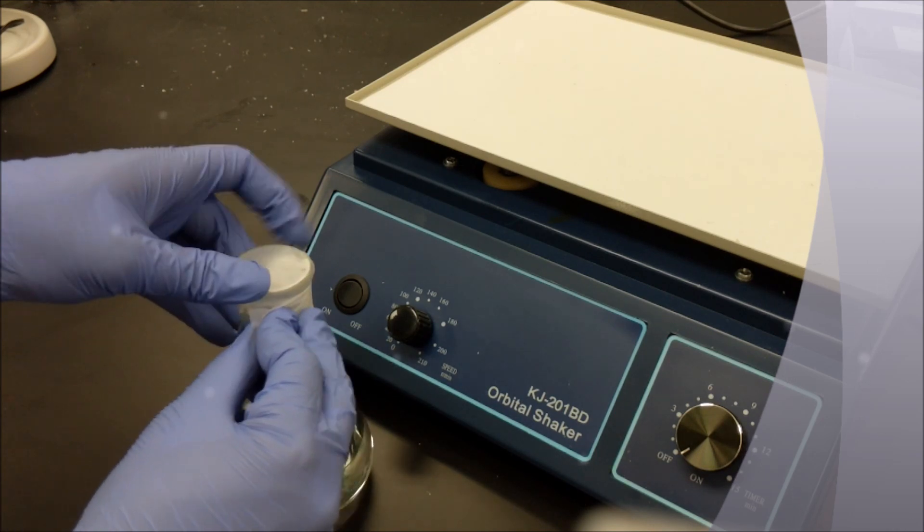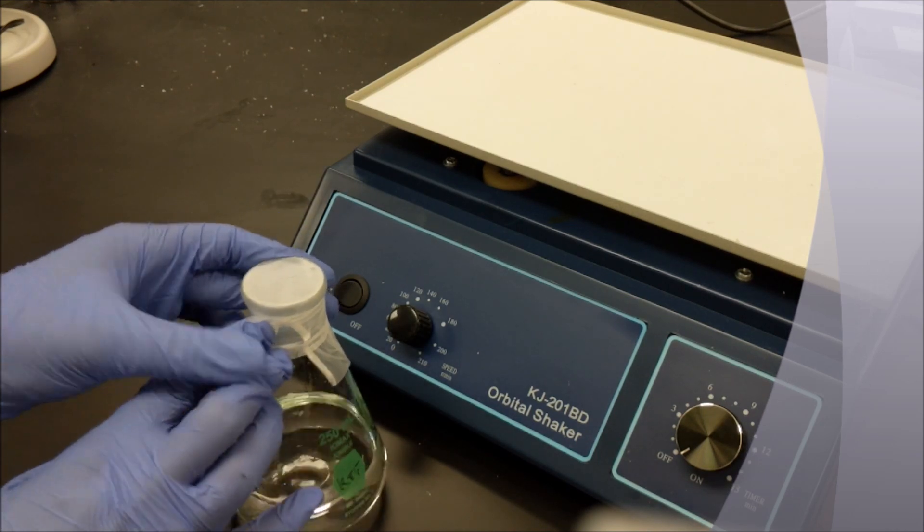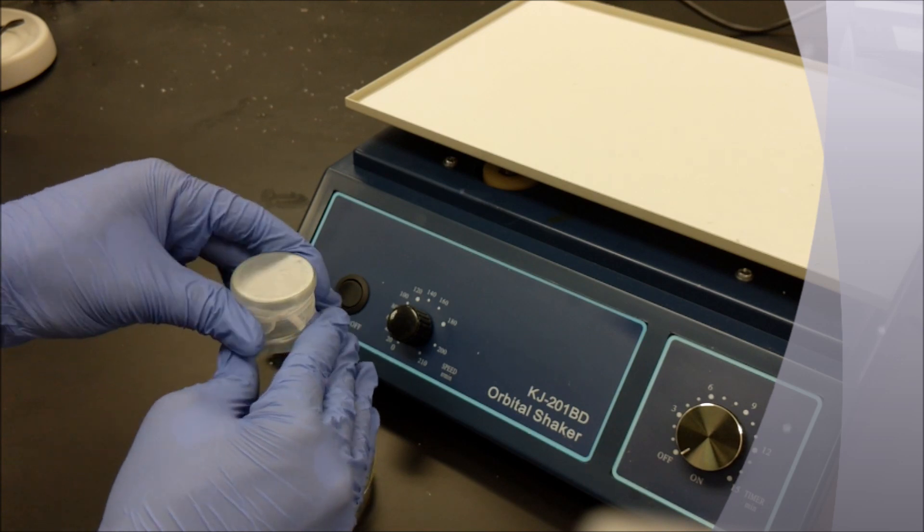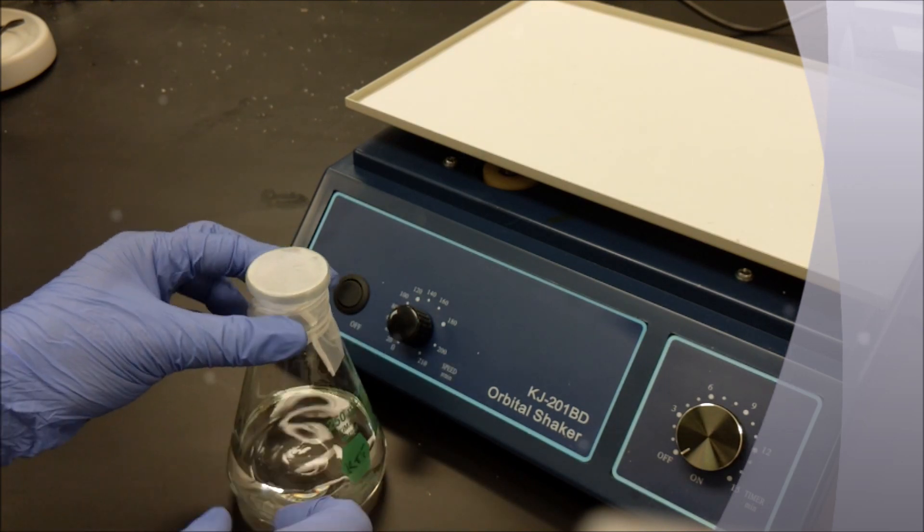When you're covering the top, pull tautly enough to ensure no solution will spill during the shaking process.